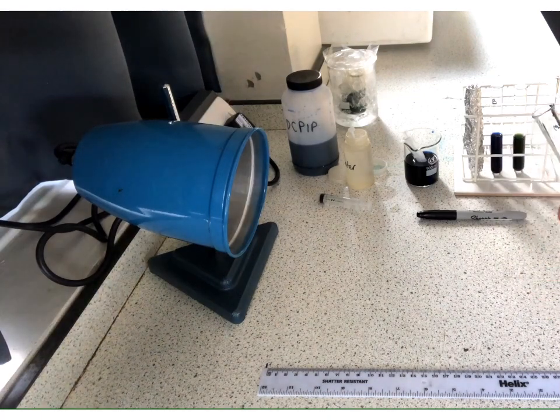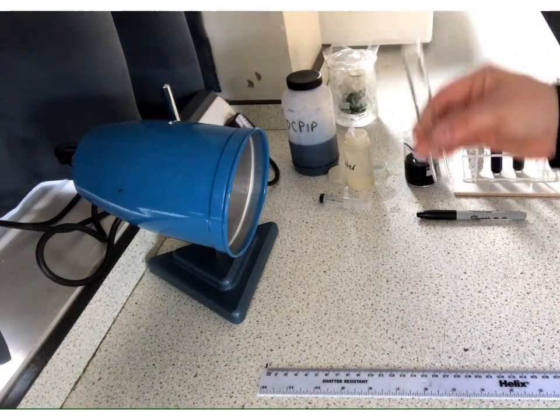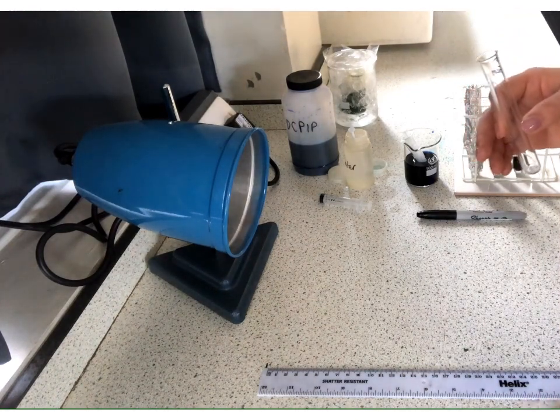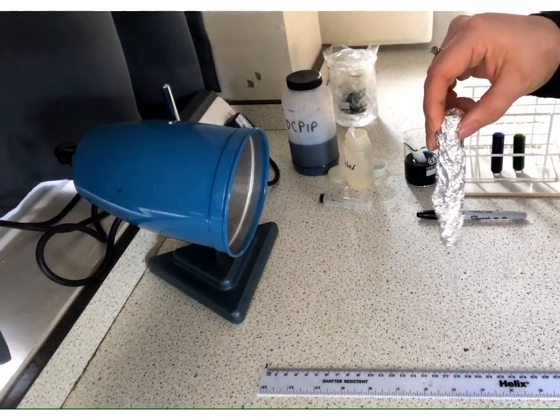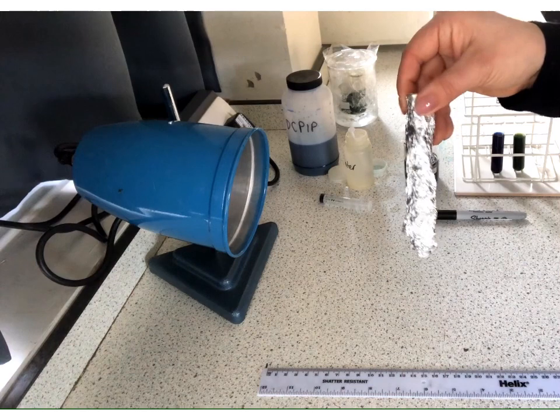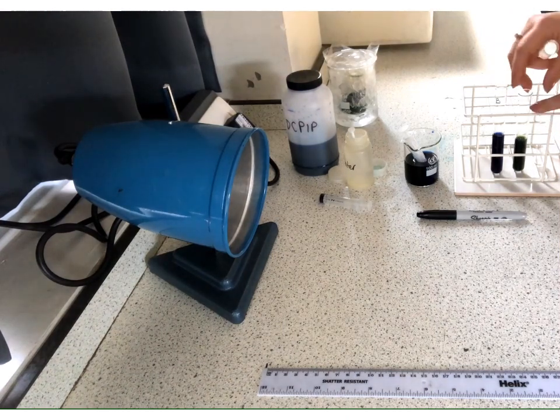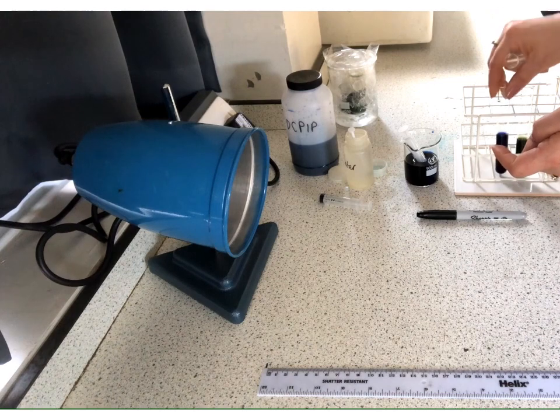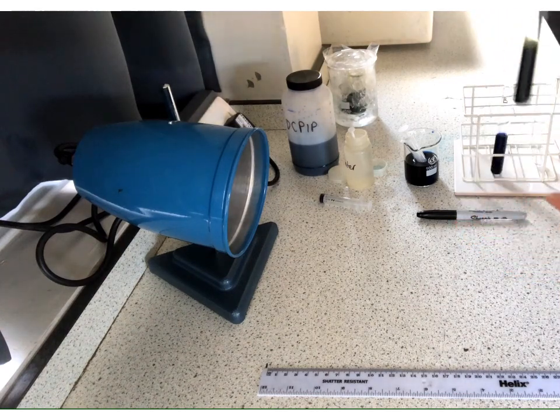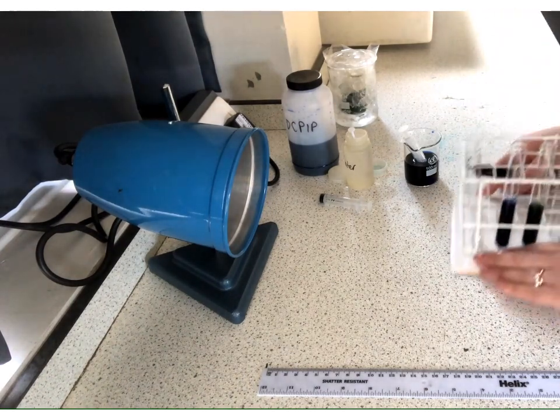So what we need to do now is make sure that we are putting the correct proportions in. So we're going to put 5 of the DCPIP, 1 of the water, and then we're going to add that 1 centimetre cubed of the chloroplast solution or suspension, mix it, and then start our timer. So we do need to be quite ready with this. Now I'm just going to take our little control one and put it in another rack just further away, because we don't want to really blast this with light, just in case we have got any cracks in our foil. So I'm going to pop that over there safely. These ones, doesn't really matter at this point. That shouldn't be doing anything because it has no chloroplast in it. This one has already reached the finale, as it were, so it's already completed all of the reduction of the DCPIP.